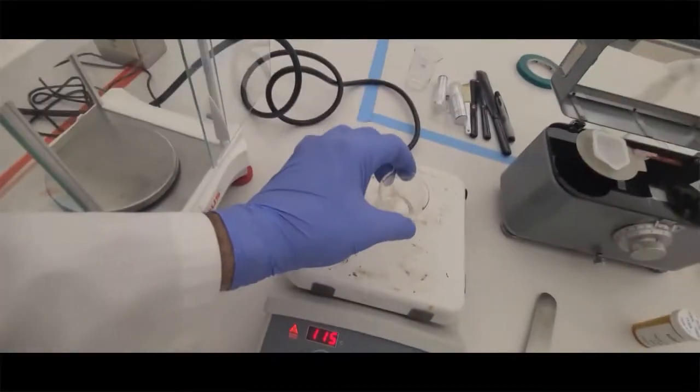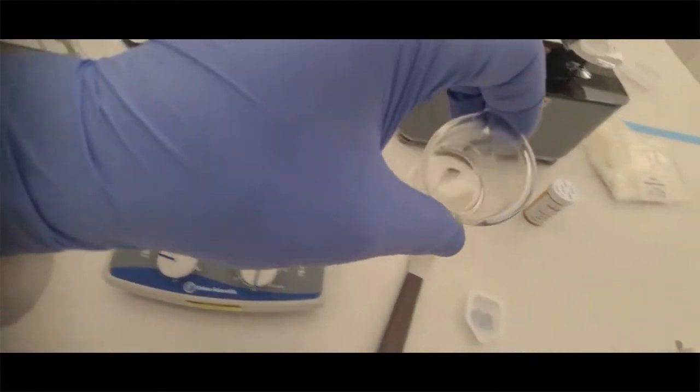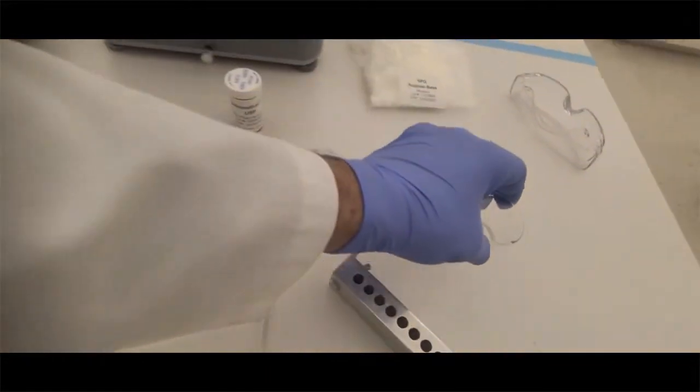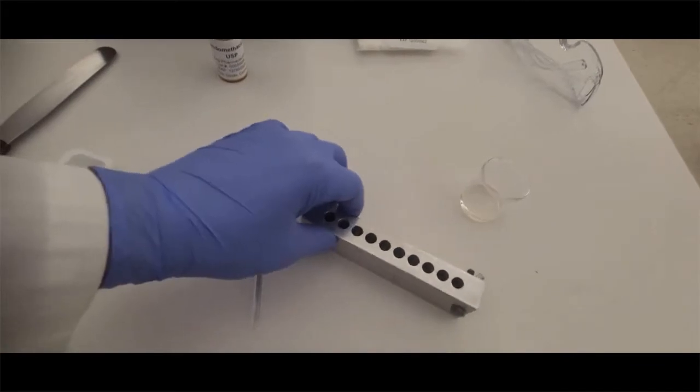Occasionally check it out—might have to mix it around. When it's completely melted, don't over-scorch it. Just when the last piece is about to melt, you can take it off the hot plate.